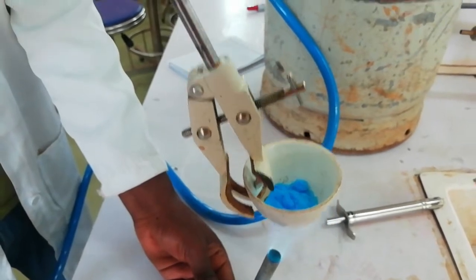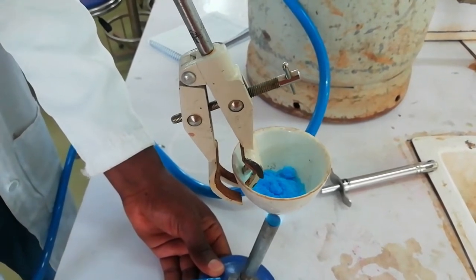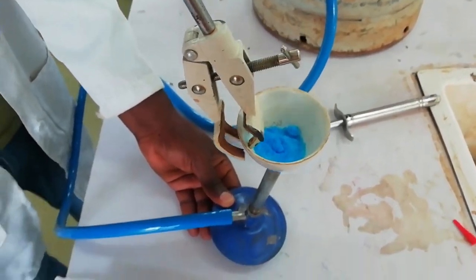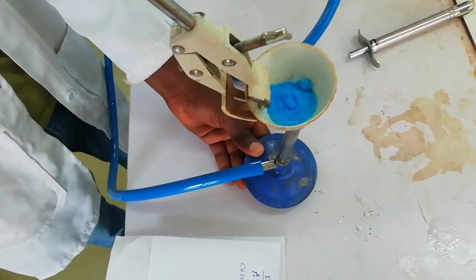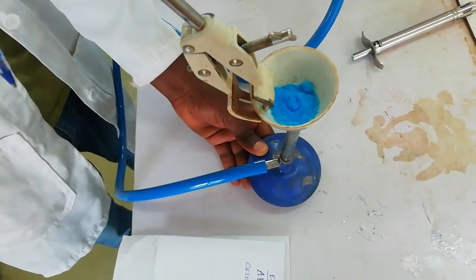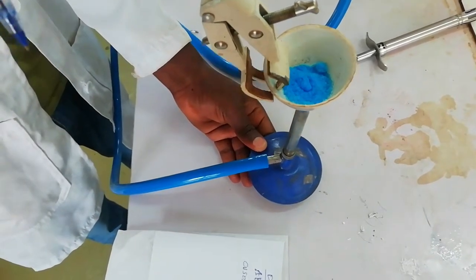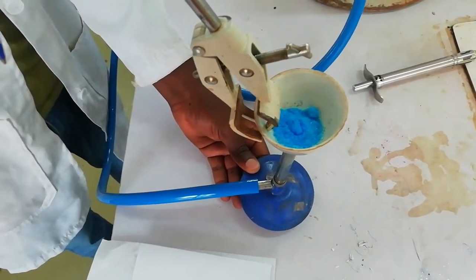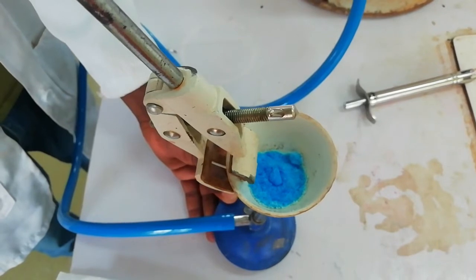Upon heating the copper sulfate pentahydrate, it converts into copper sulfate which is a white powder. In your observation part you can write that when copper sulfate pentahydrate was heated it converts from blue crystal to a white crystal. The blue color is copper sulfate pentahydrate and the white powder is anhydrous copper sulfate. Upon heating, the water removes from the copper sulfate.